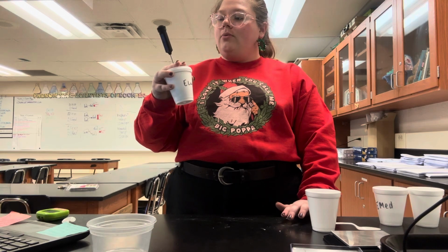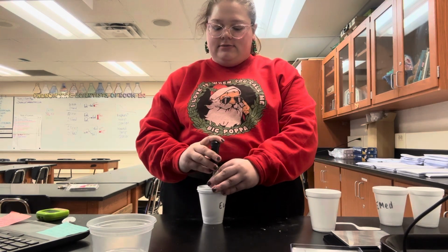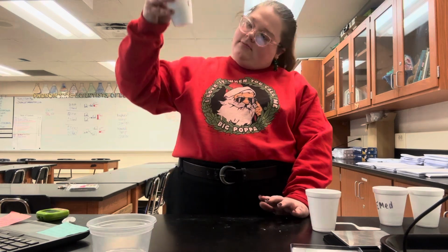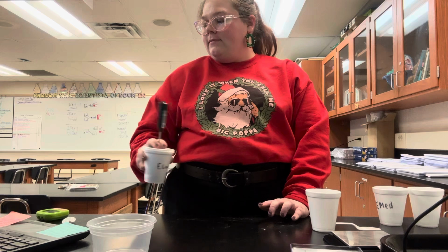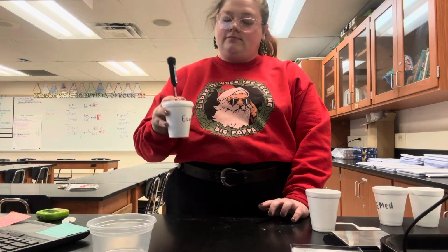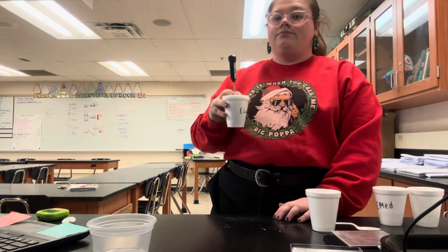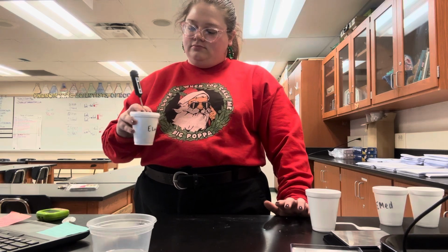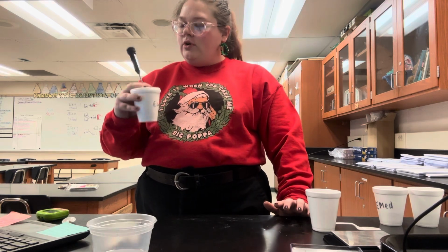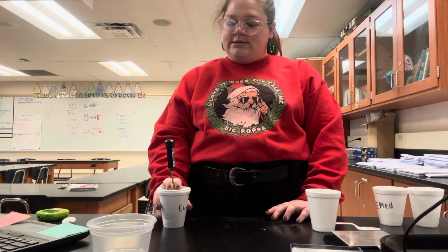One minute in, we are still at 17.0 degrees Celsius. One and a half minutes in, we're up to 18.1 degrees Celsius.